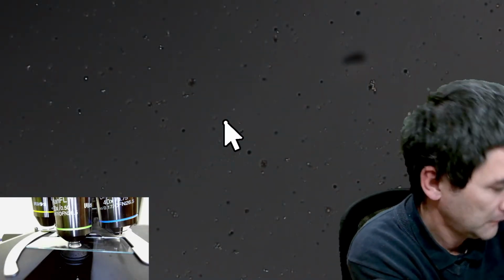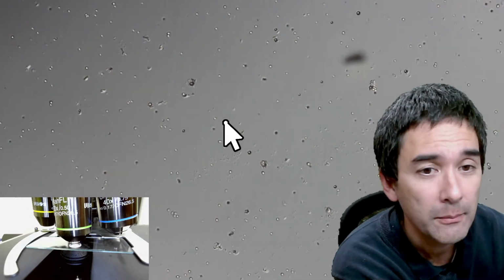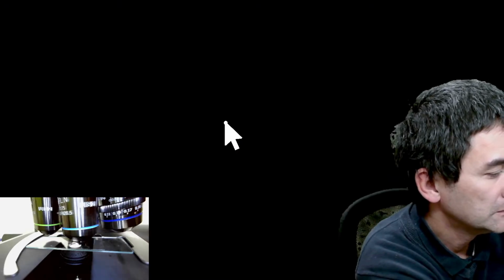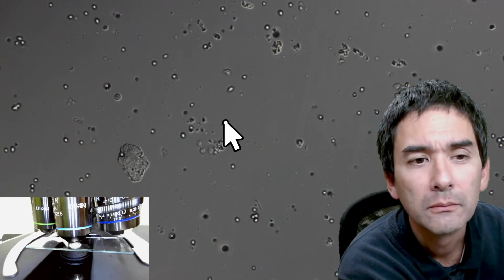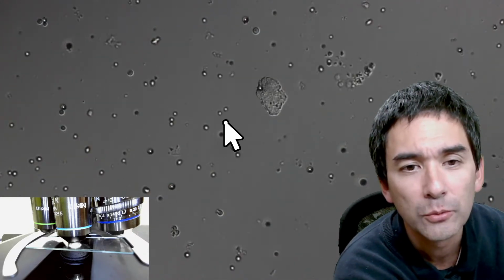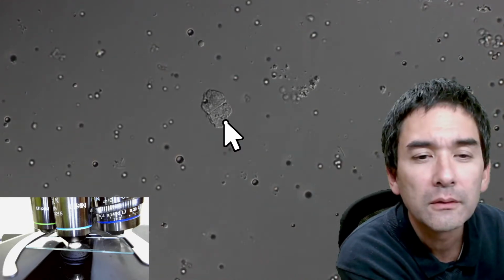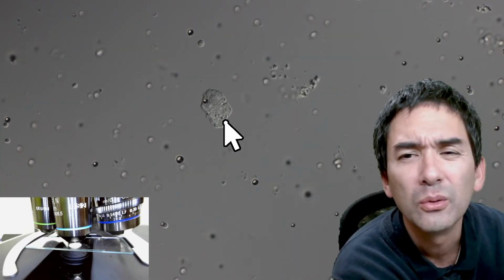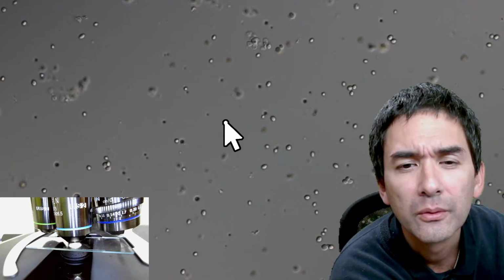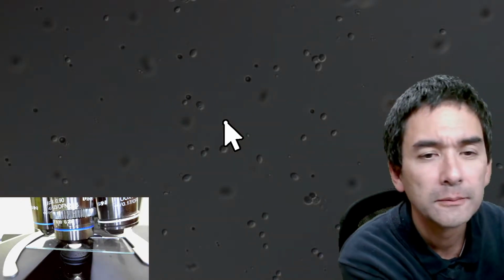So let's go up yet further. And here we already start to see them. Interesting, there's some other stuff here as well, some contaminants. I don't know what this is. Okay, but you get the idea. And let's open this up a little bit. What? No, this is kind of weird. Here they are. Okay. And 60 times.